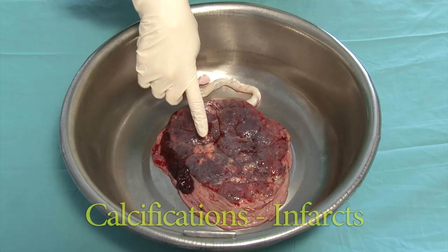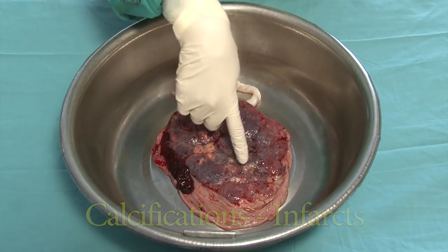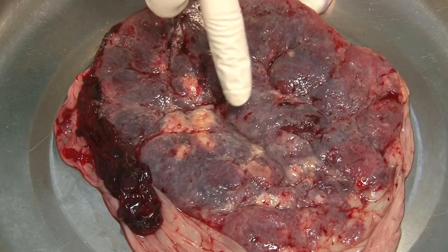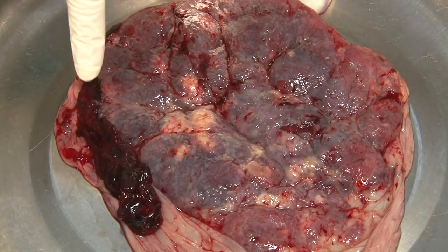Here are calcifications and infarcts, which look similar. When cutting through calcifications, they are more superficial, while infarcts sit deeper. Furthermore, there is a hematoma present.